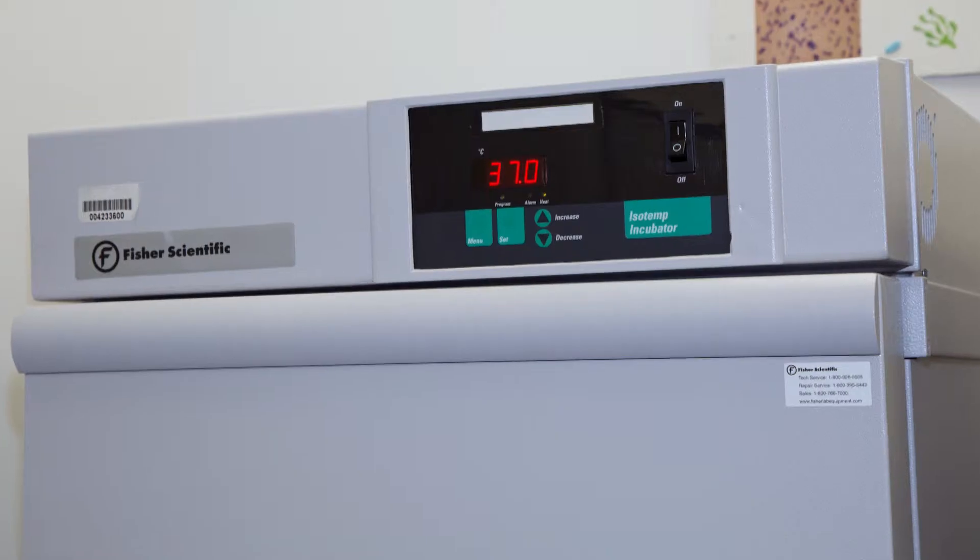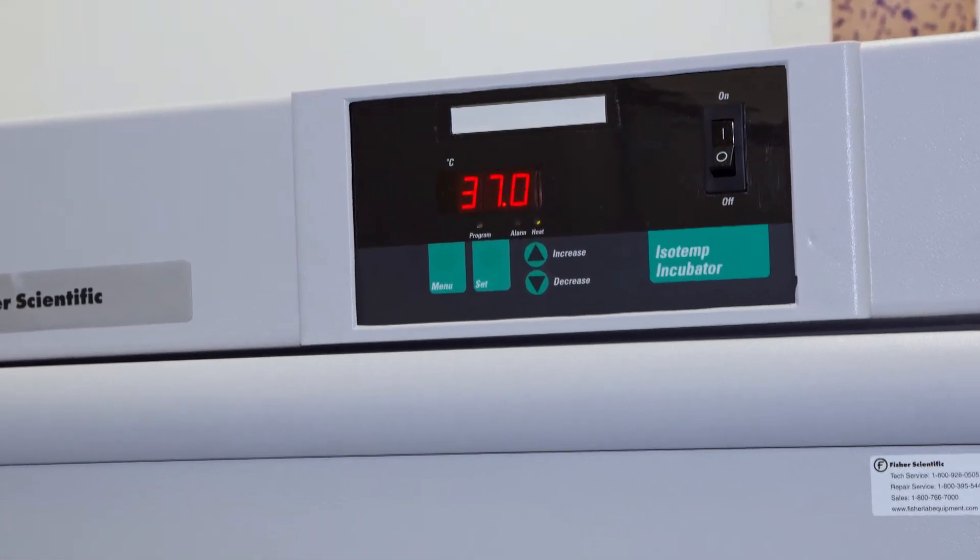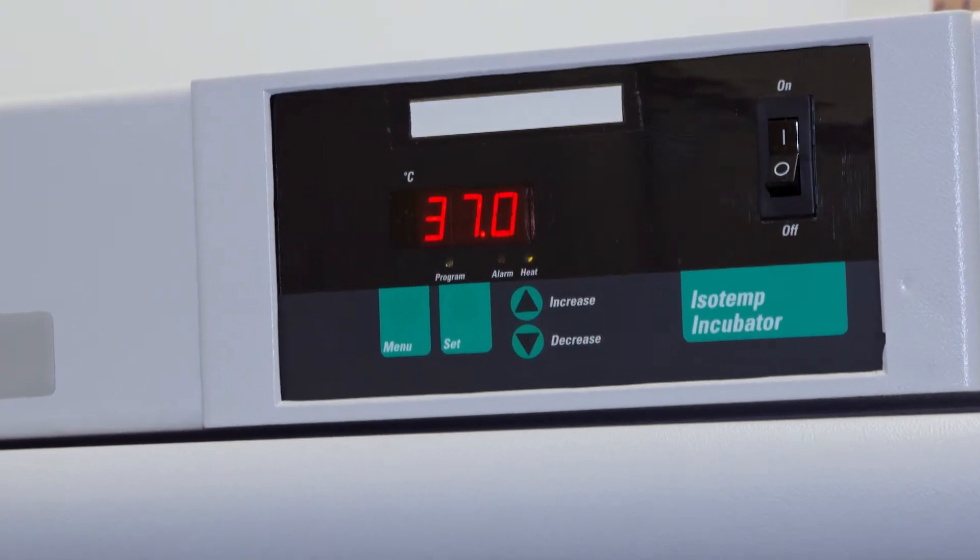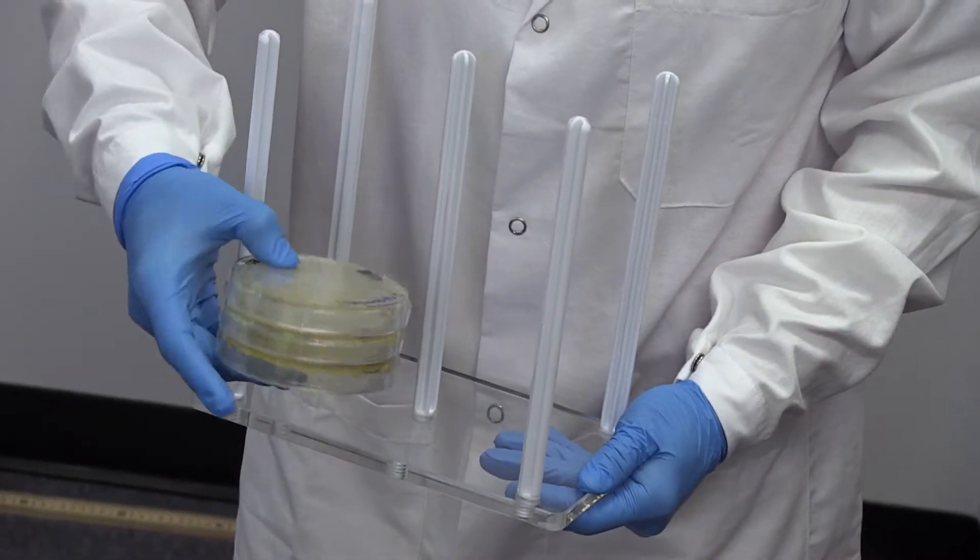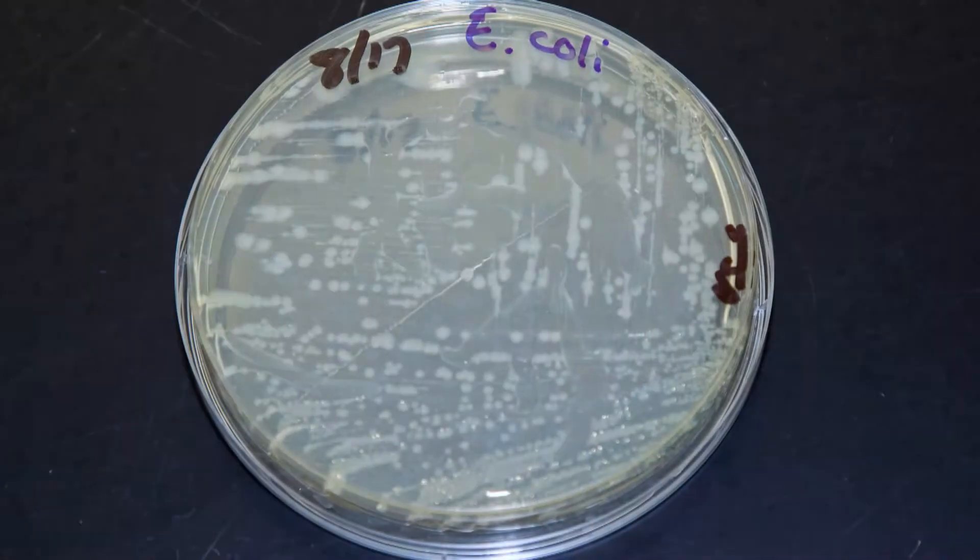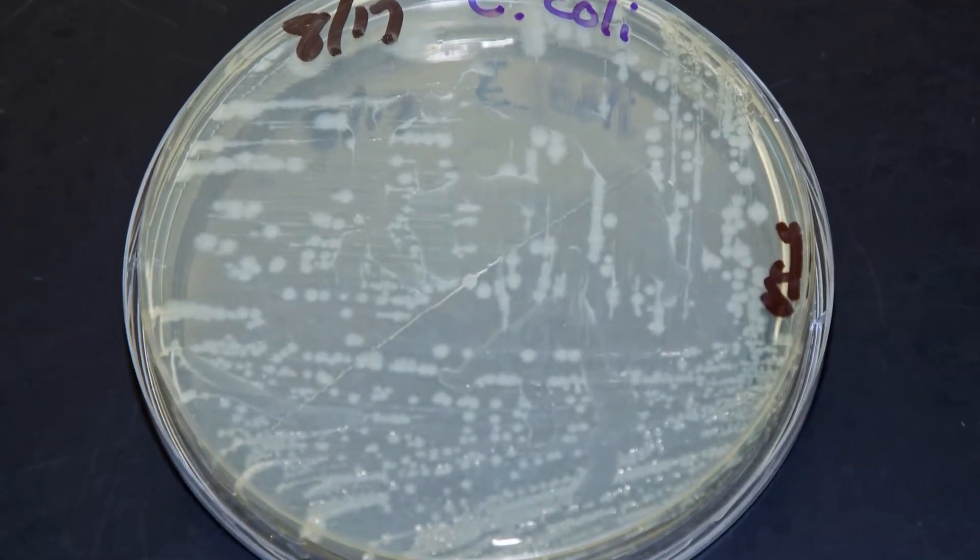After incubation at 35 to 37 degrees Celsius for 16 to 24 hours with the bottom up, the plates can be observed for isolated colonies.